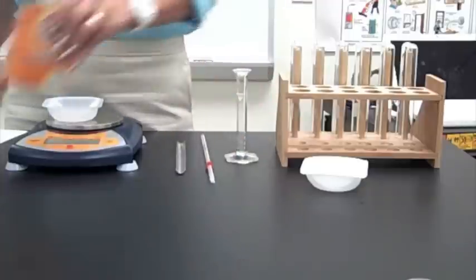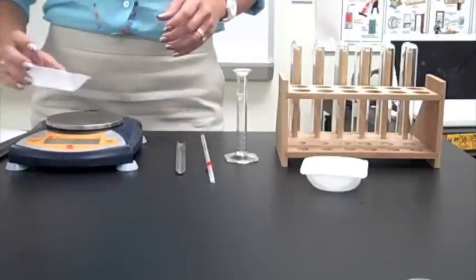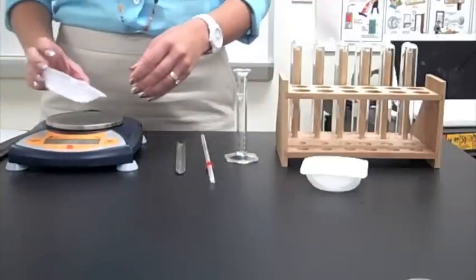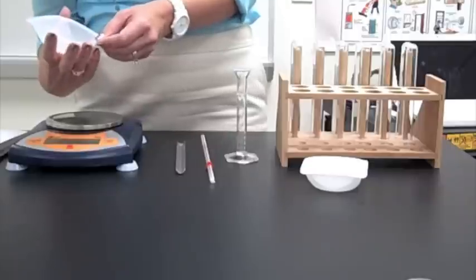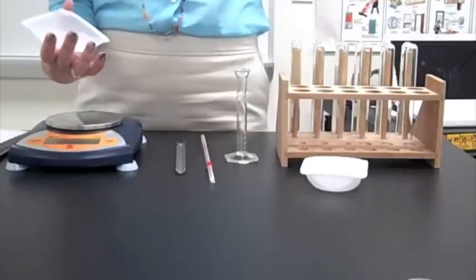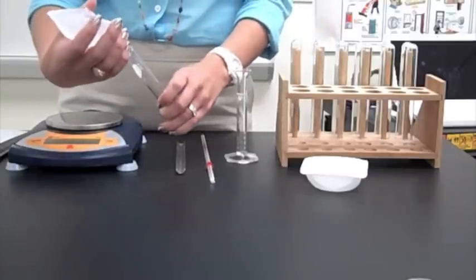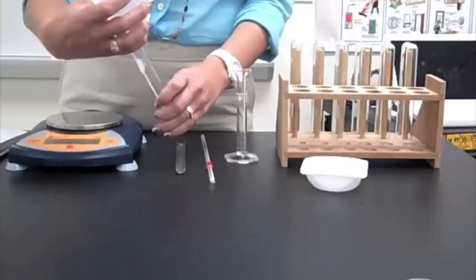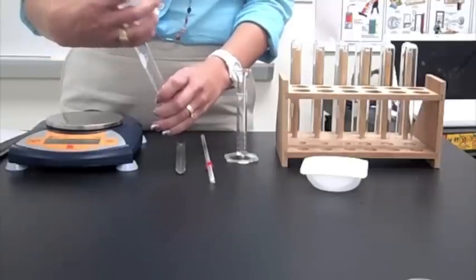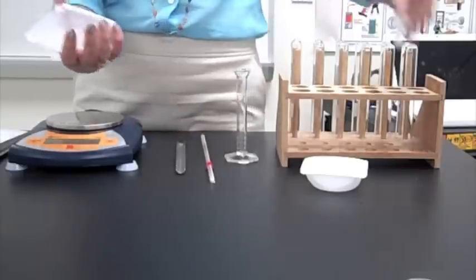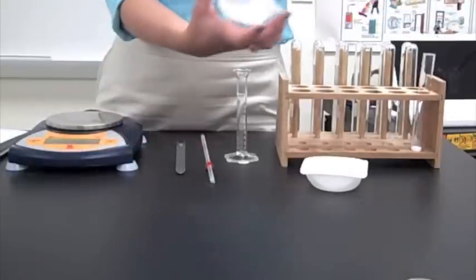That's close enough. 1.42. Kind of shake it all down to the bottom corner. Pinch opposite corners. And you're going to take it and transfer it into a clean and dry test tube. And then this weigh boat goes in the trash.